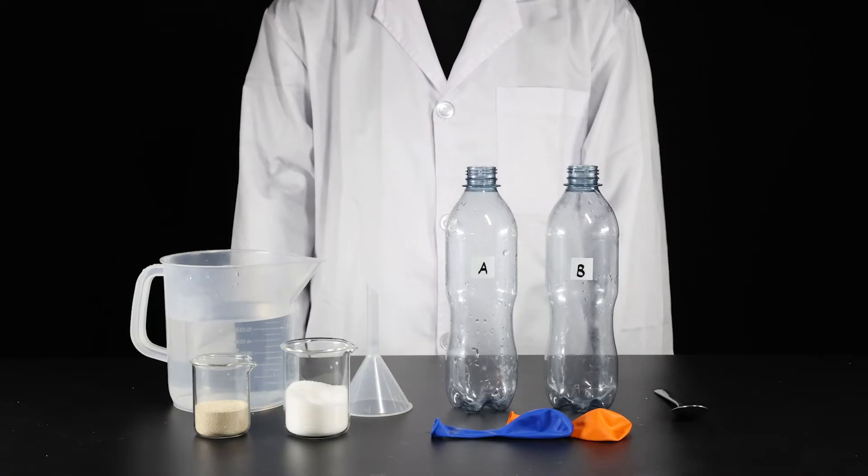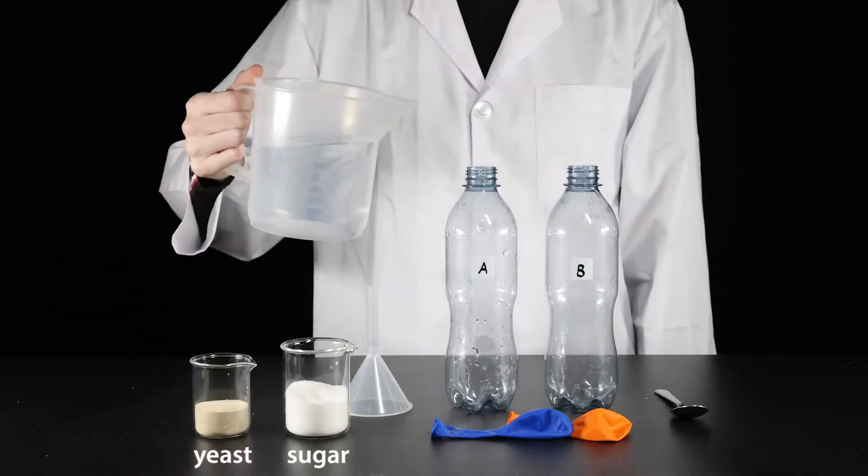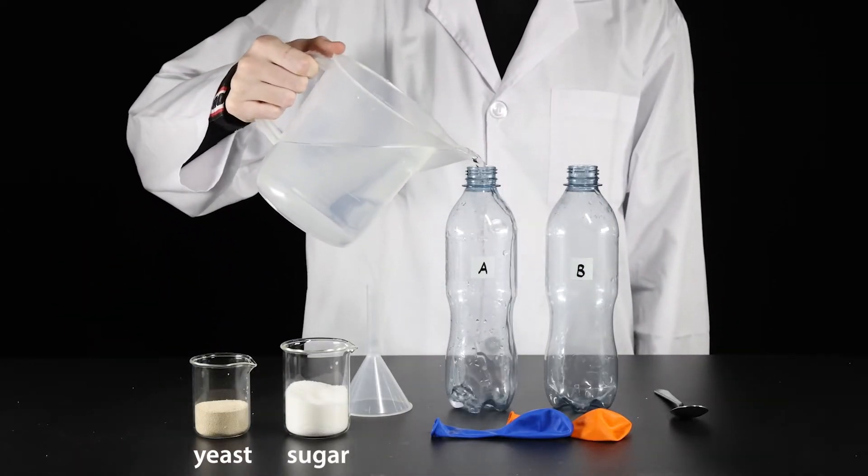Here we have two bottles, bottle A and bottle B. Let's add an equal amount of warm water and yeast to the bottles.